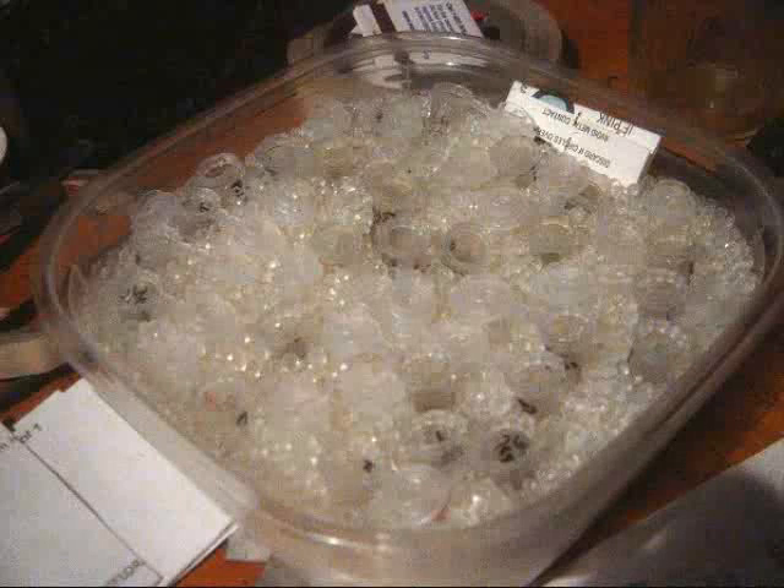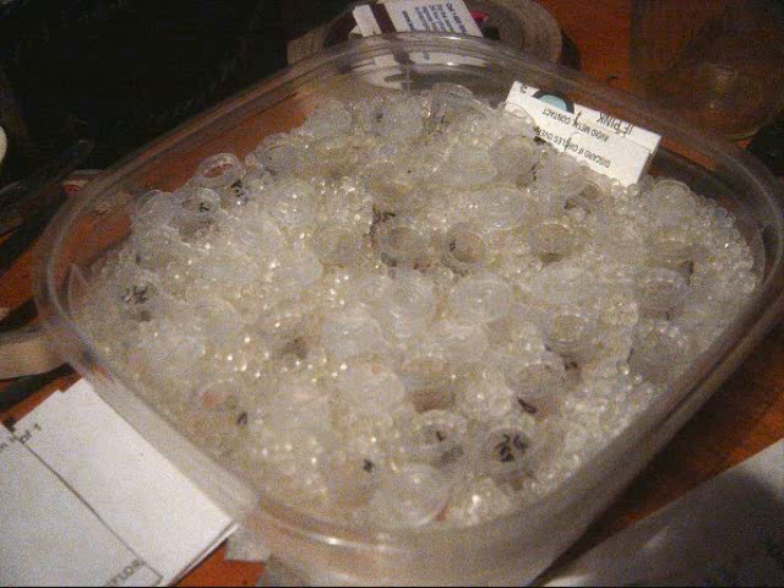Turn it on its side and gently tap the pollen into the micro tube. Mark it with your marking pen — make sure you have it named. Then leave the open tube in the silica gel inside the ziplock container.